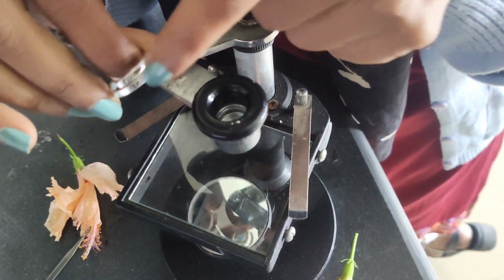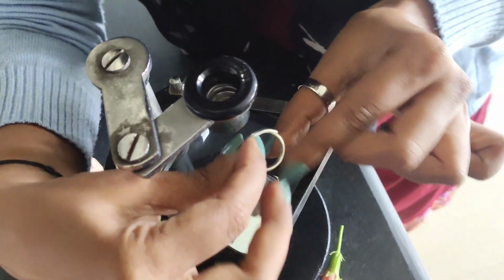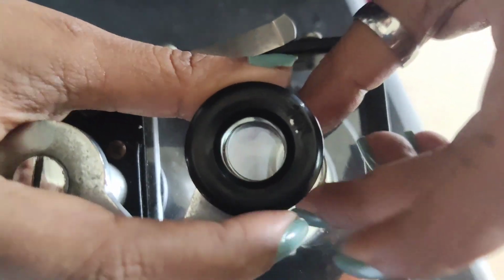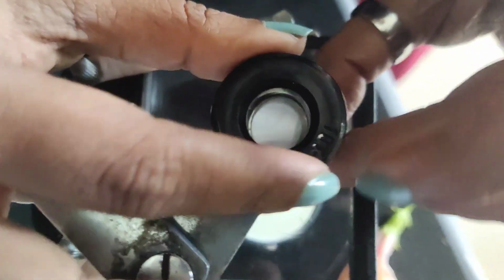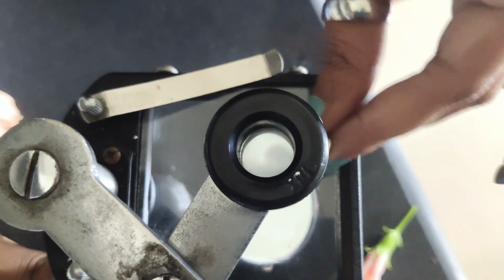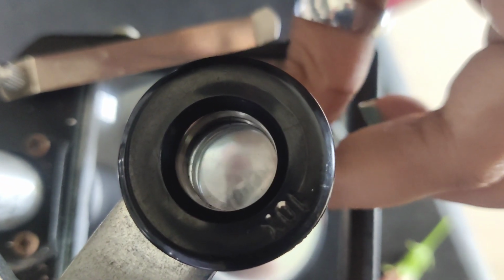So here there something is written on the ring. If I try to show you in the microscope, first of all it is important whether the light is passing or not. If I just try to show you, you'll be able to see this. See. First of all, it's giving me a larger working distance, and if I try to show you, see this is looking so minute, right? Yeah, but if I'll just increase it, just look at the letters now. They are easily getting magnified. Let us focus the light. Yeah, the letters are easily getting magnified.